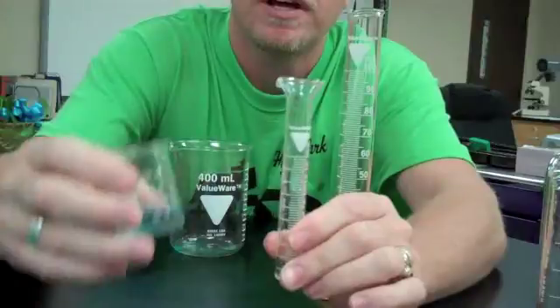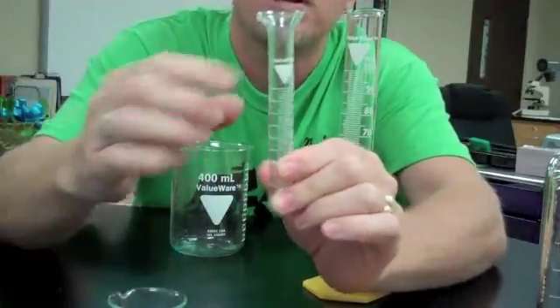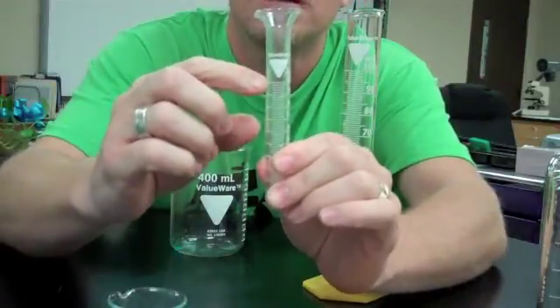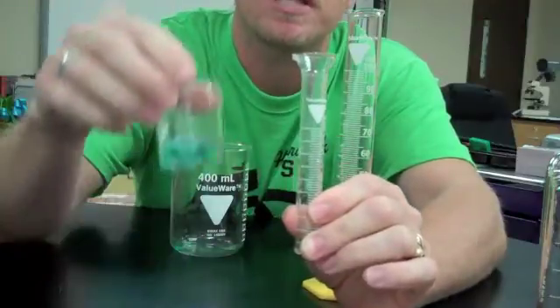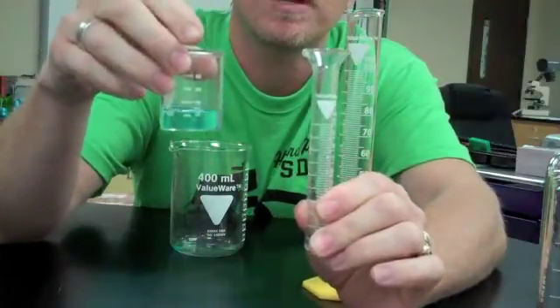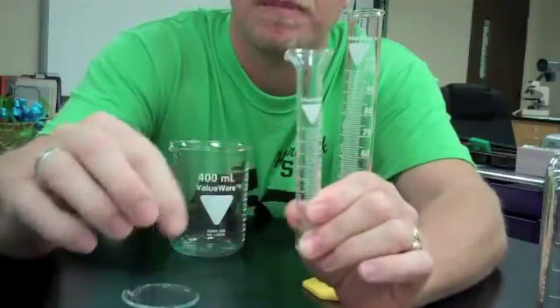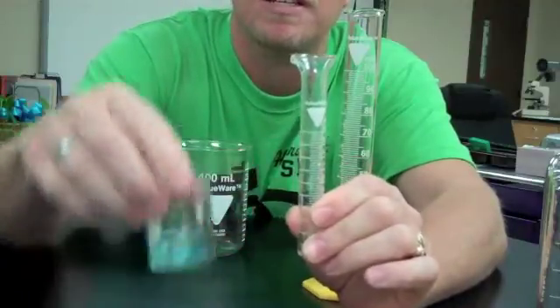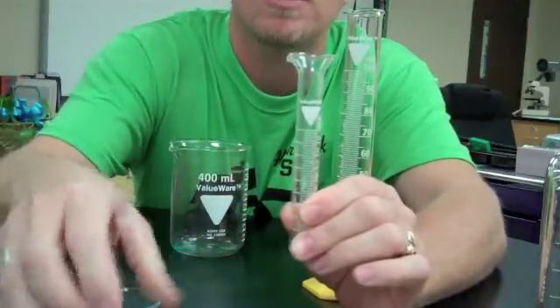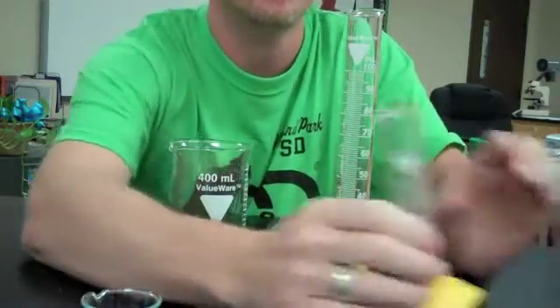This small one only registers up to 10, and my volume obviously exceeds 10 milliliters, so I'll be past the mark - that one won't work for me. So I'm going to go to this 25-milliliter graduated cylinder.